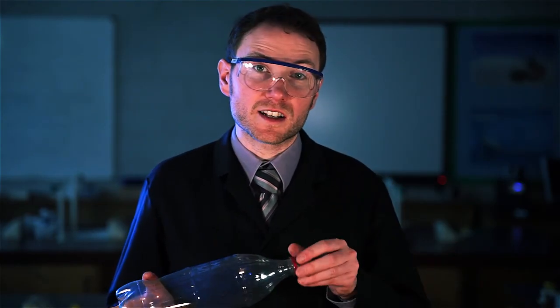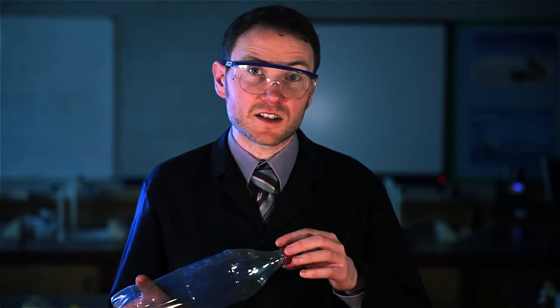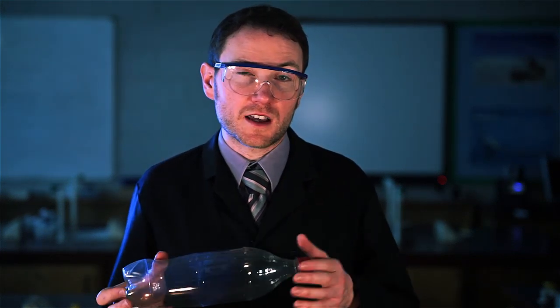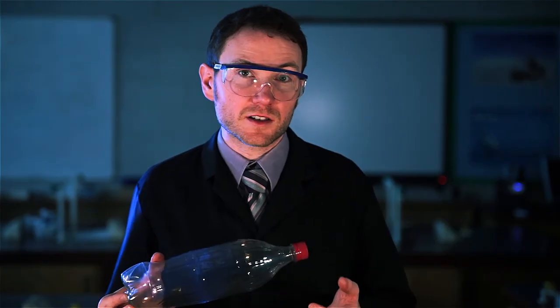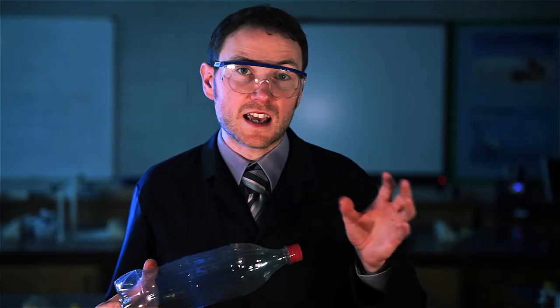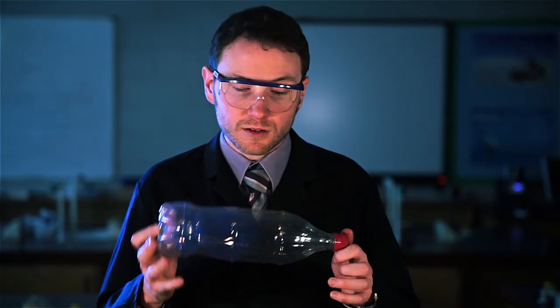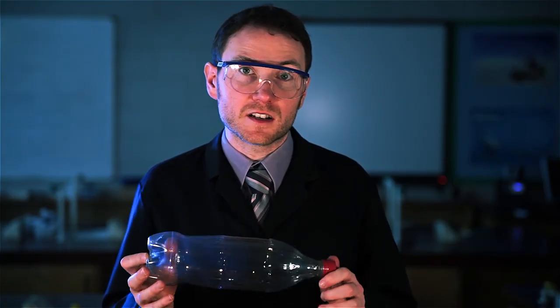Now before performing the demonstration, the first thing you need to do is to dispose of the excess ethanol. That can be done down the sink with plenty of water. Many of the accidents that are happening at the moment with the methanol whoosh bottle are to do with the fact that a little bit too much methanol is being used, and also potentially that the excess methanol is being kept too close to the demonstration while it's happening. So make sure you dispose of that. The bottle will last for a decent while before you need to light it.